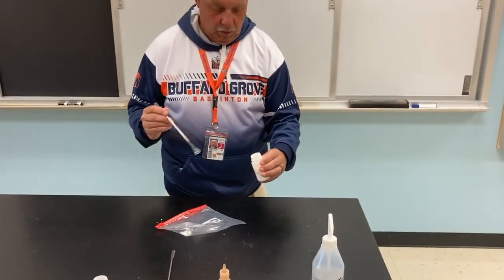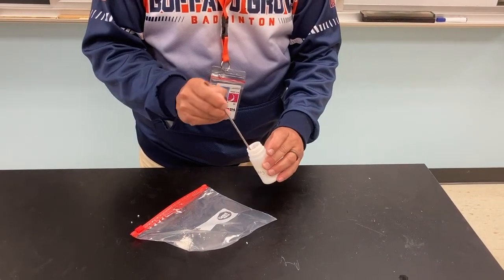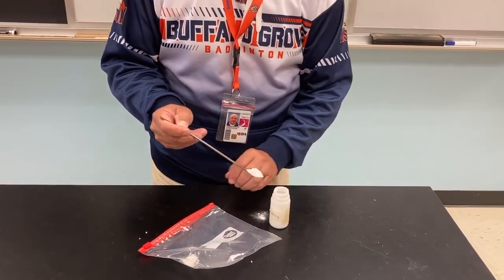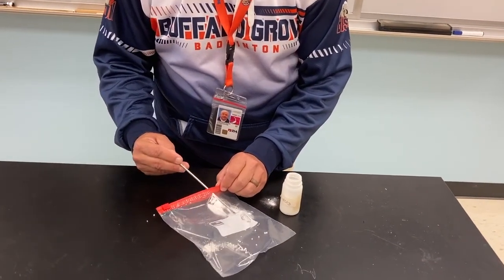And then we're going to take the sodium chloride, bicarbonate, sorry. That was a good helping right there.